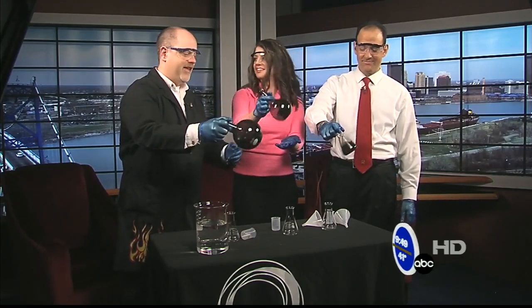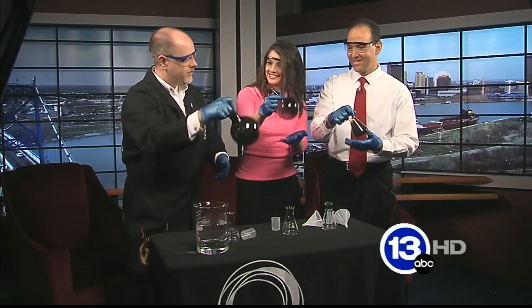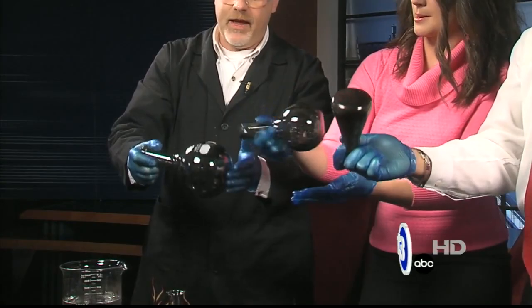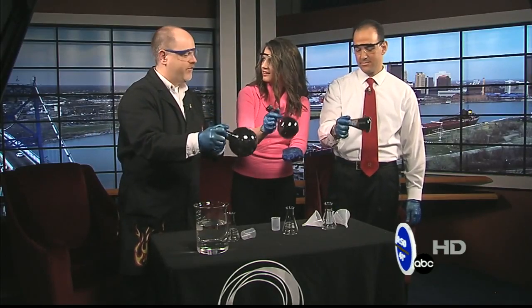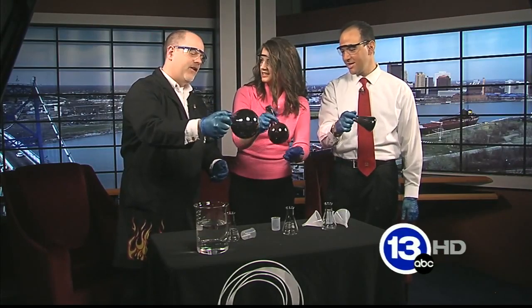I'm starting to see myself. Mirror, mirror. Tony, you want to invert yours — you want to get the whole thing coated, the whole inside. Now every time I show people this, it's like magic. You can show them the end product, which is like a silvered flask, but when you actually do it yourself and see this — I'm seeing myself more clearly. It starts off kind of dark.